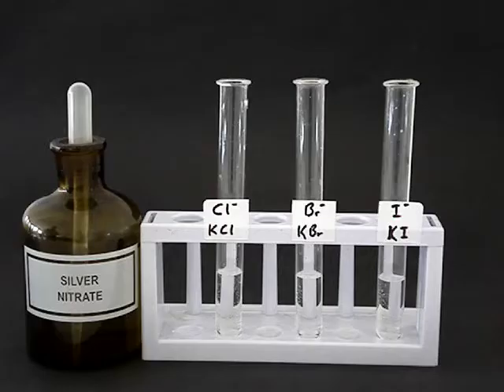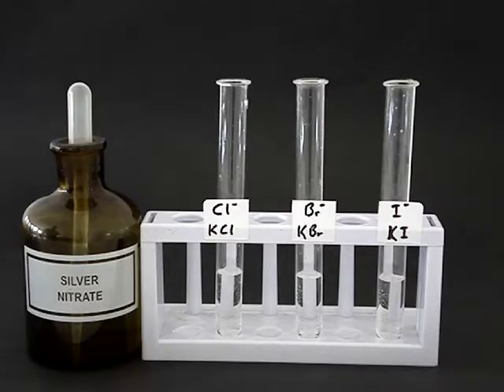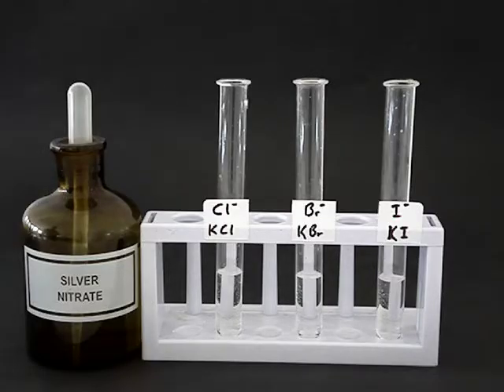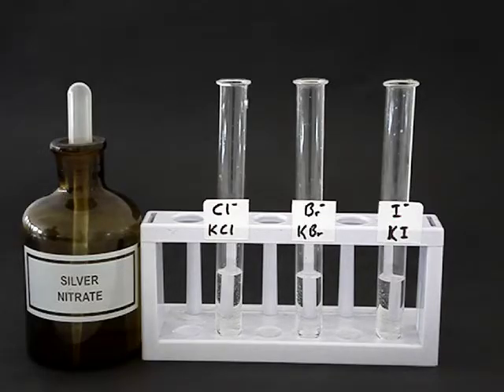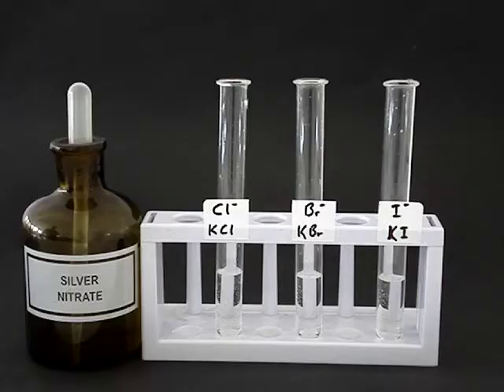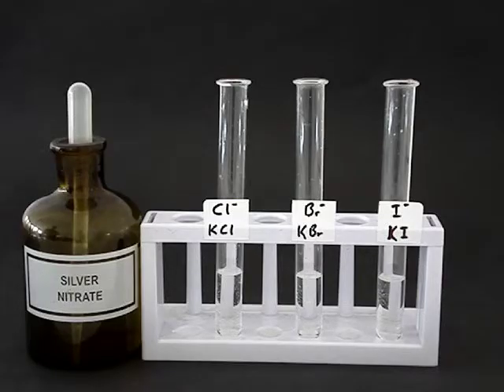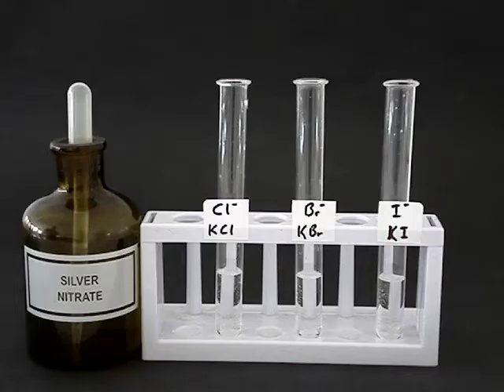The middle test tube has bromide ions and the third one has iodide ions. We're going to make that visible by adding silver ions to show up the fact that those halides are there.